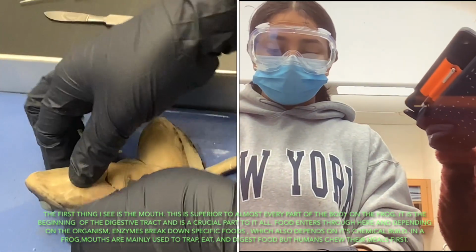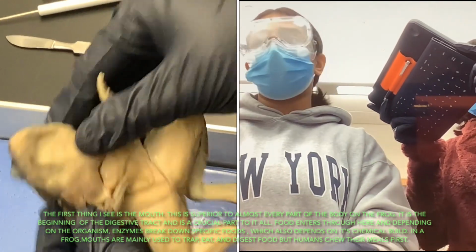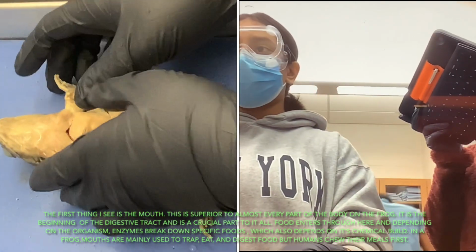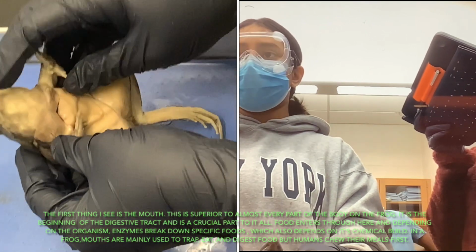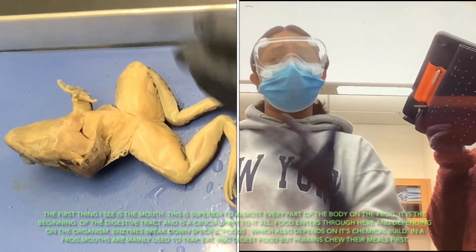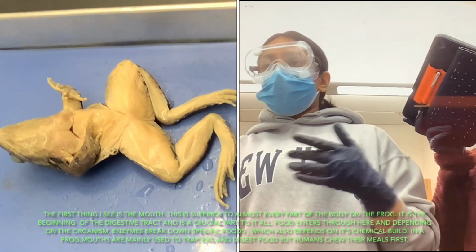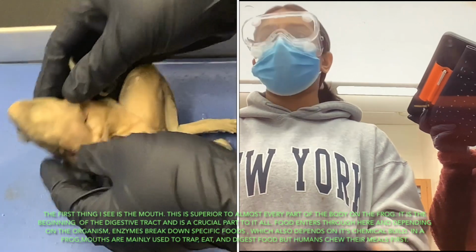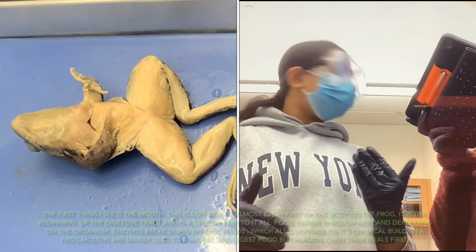So the first thing I see already is the mouth. The mouth is the first part of the digestive system. It is superior to almost every part of the body, and it's the beginning of the digestive tract, a very crucial part to it all. Food enters through here, and depending on the organism, enzymes break down specific foods depending on their chemical build. In a frog, mouths are used to trap their food and digest it, and we actually chew ours and swallow it.